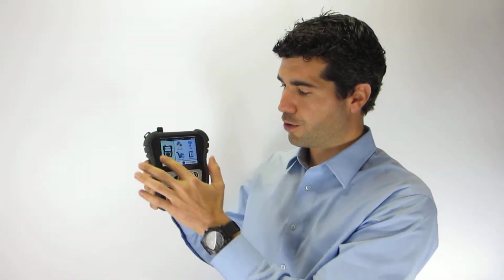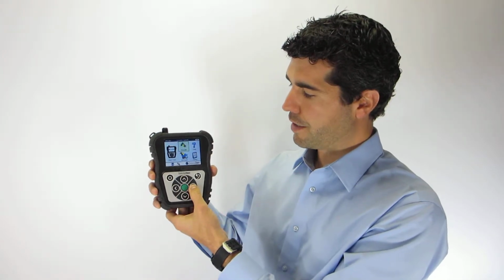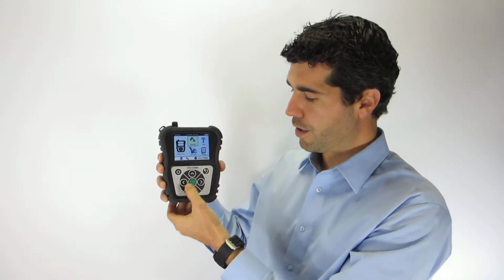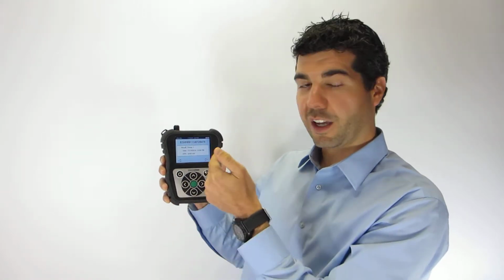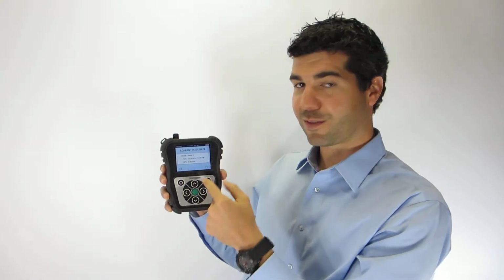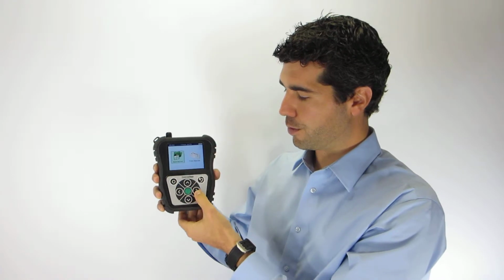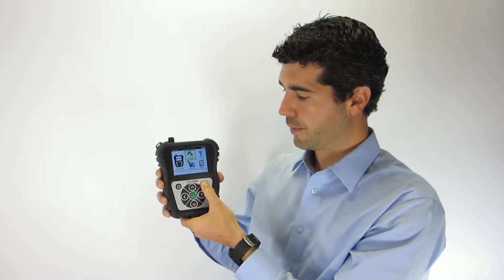In the last video I showed you how to use the left side of the screen, which was the run test. On the right side, as you scroll across, you'll see several options. I'll go right into each one. The results will allow you to go to the most recent result in chronological order. The last test from the last video, you remember, was a nitroaromatic, shown right here. You could also take the same card and use the barcode scanner to pull up those results.